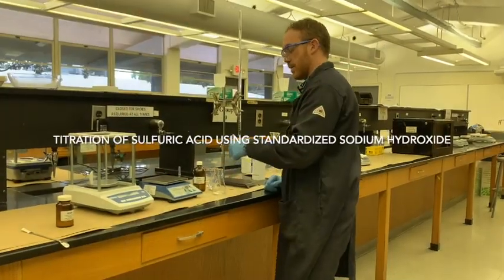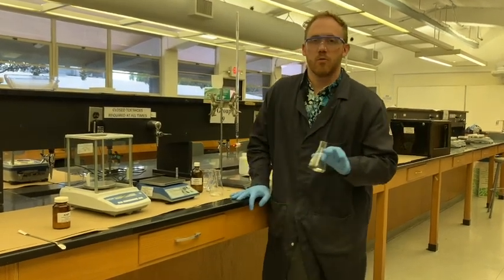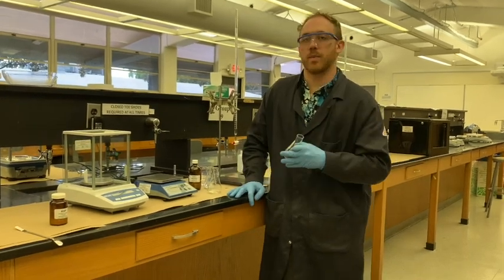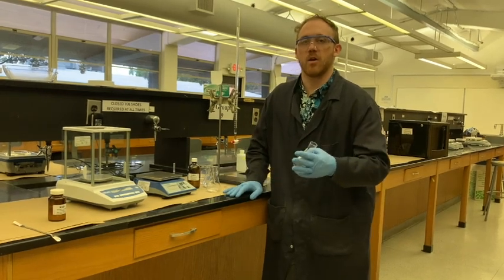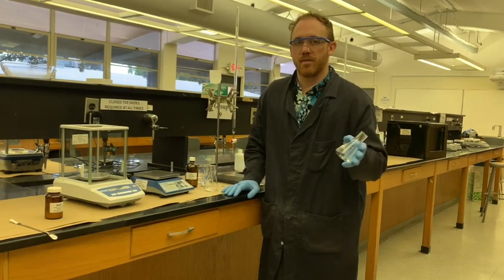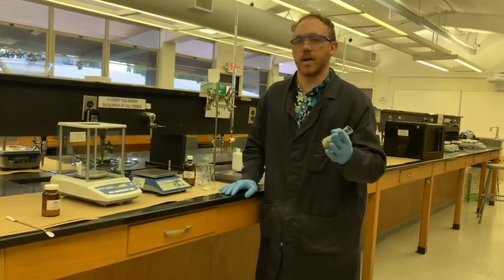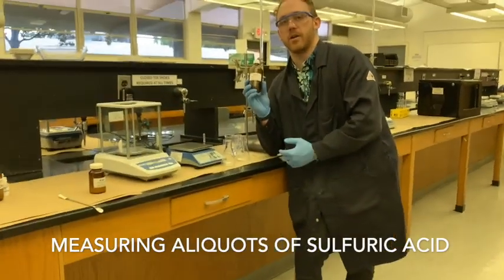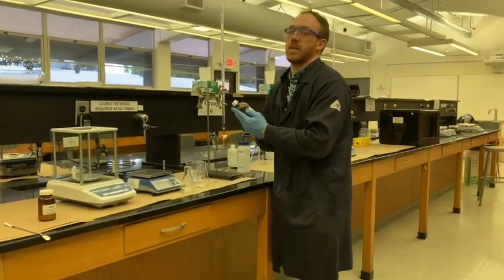All right, so what we've done so far is we've taken some KHP, we've titrated that KHP with some NaOH solution that we prepared, and using calculations, we actually can figure out what the concentration of the NaOH solution is. Once we have that molarity, we can apply that to virtually any acid solution that we find. So when we have H2SO4, let's say an unknown solution, we don't actually know what that concentration is.